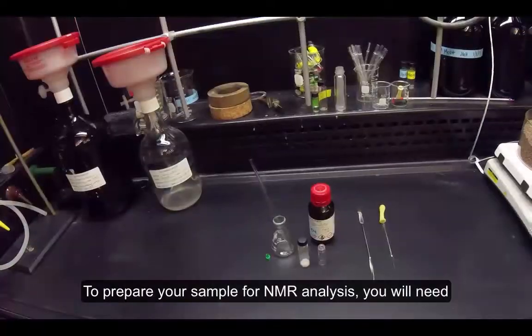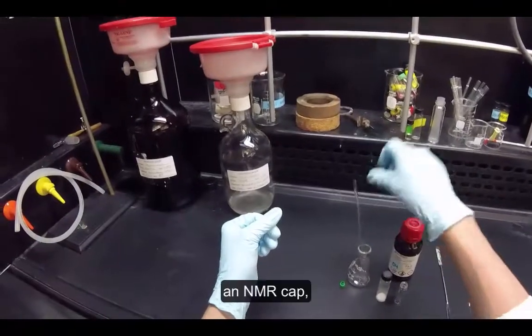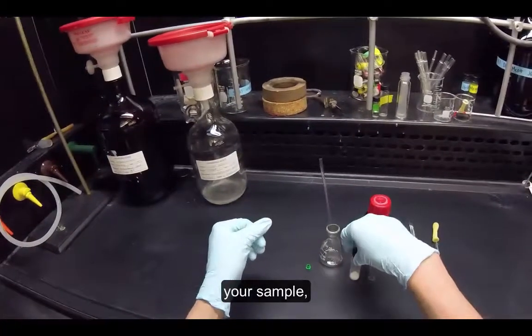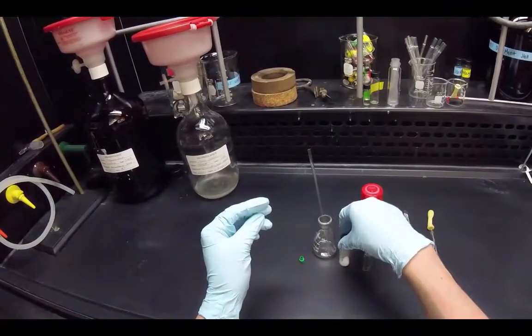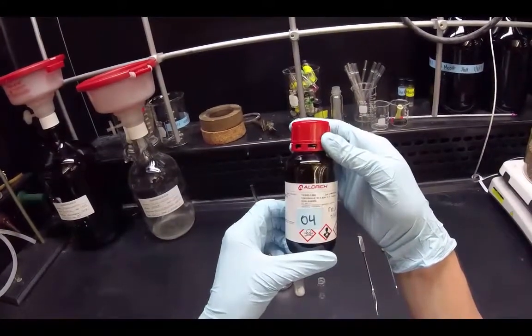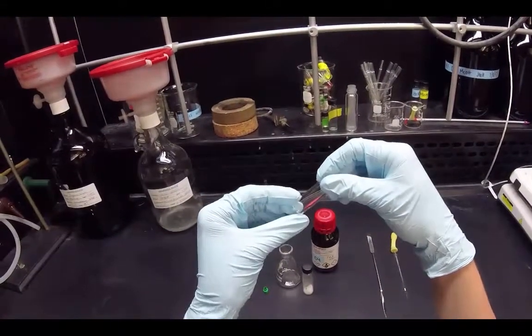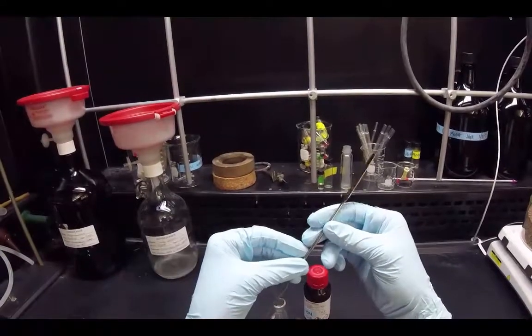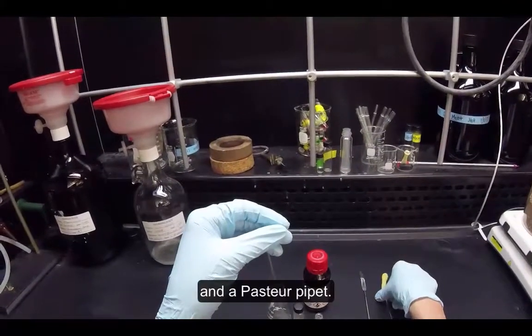To prepare your sample for NMR analysis, you will need an NMR tube, an NMR cap, your sample, deuterated chloroform, a small sample vial, a spatula, and a Pasteur pipette.